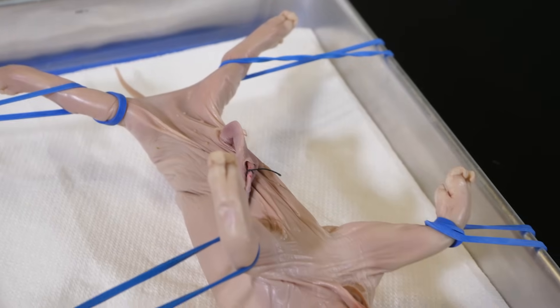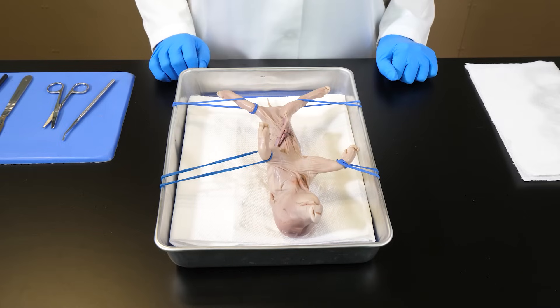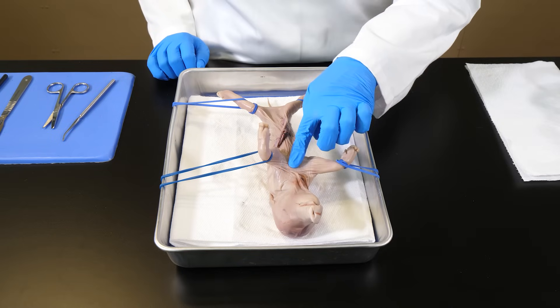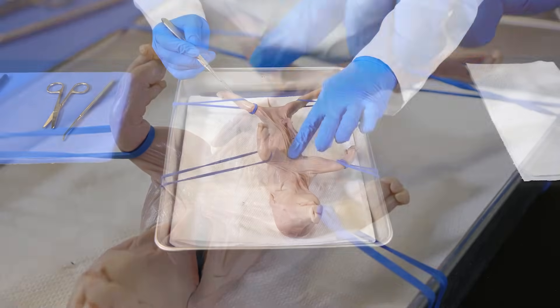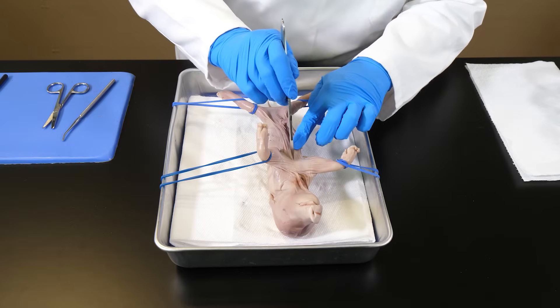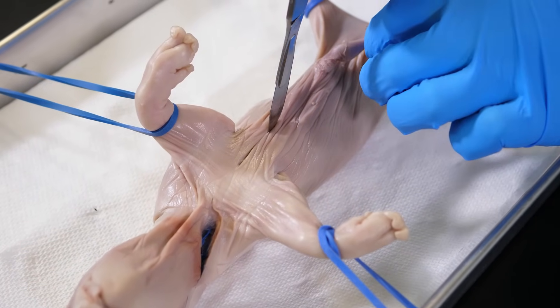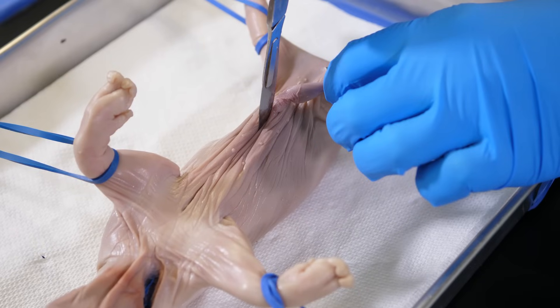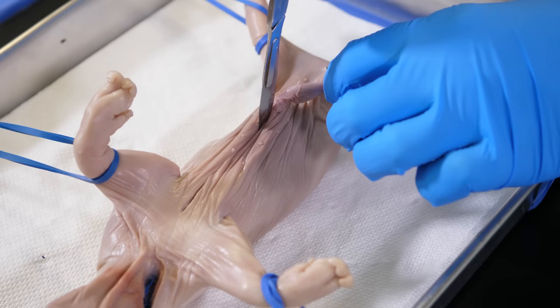Before we begin the dissection of the fetal pig, it is important to secure its legs with rubber bands. Now that the legs are secured, we are ready to make our first incision. We must first locate the sternum by pressing on the skin in the upper part of the ventral surface. Our first incision is a medial incision along the axis, starting about halfway down the sternum. While cutting the skin covering the thoracic cavity, the sternum will protect the internal organs. However, caution must be taken when cutting the skin posterior to the sternum, because we could cut too deeply and damage internal organs.